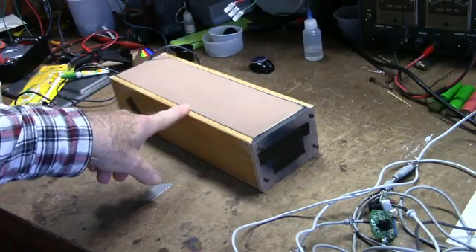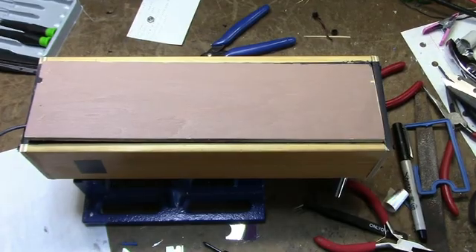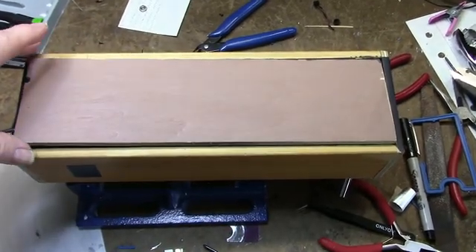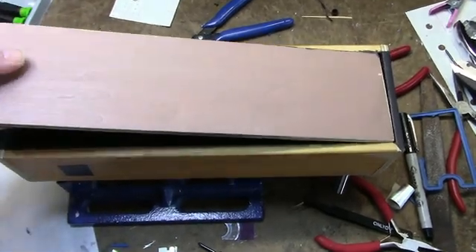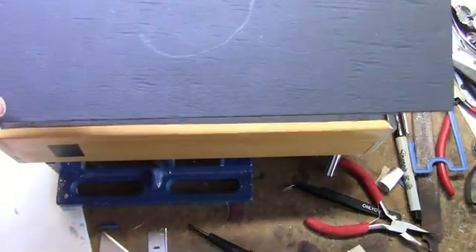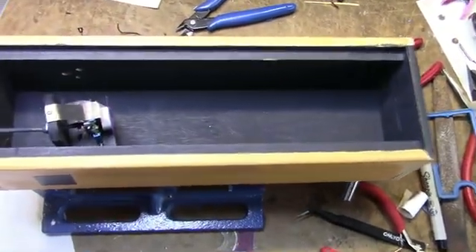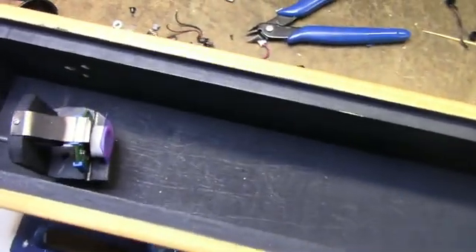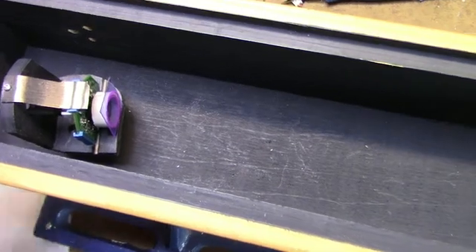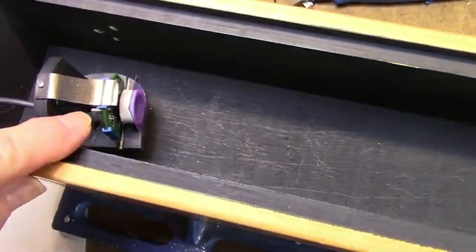Next we'll look at the innards of the spectrometer here. Here's a little more detailed view of the innards of the unit here. Take this off the lid because the inside is all painted black. Here's the actual assembly that I constructed. It's basically a little turntable. The webcam is mounted here.